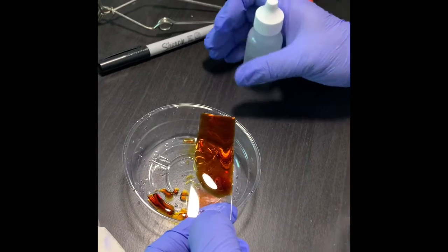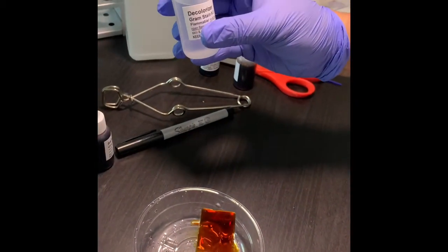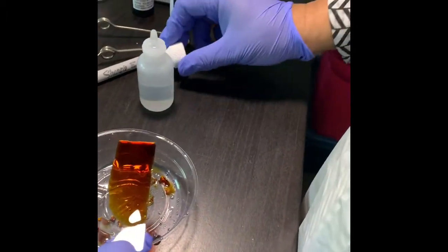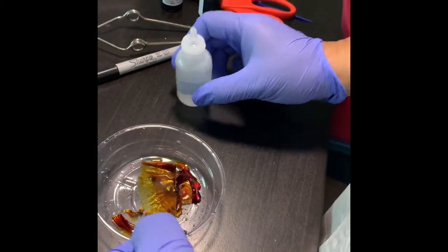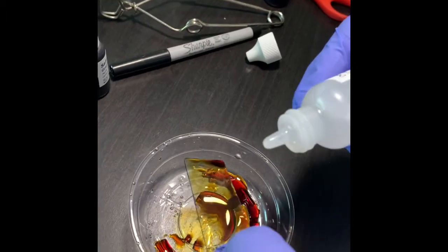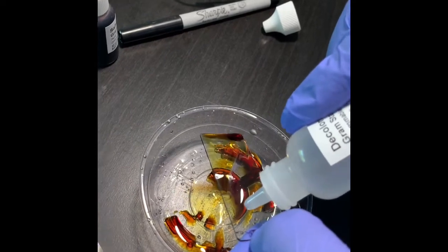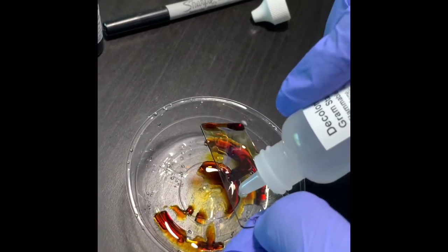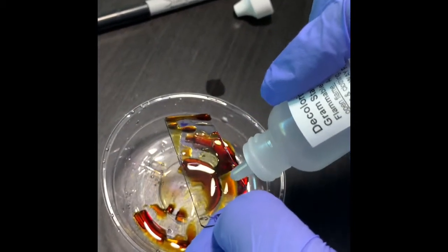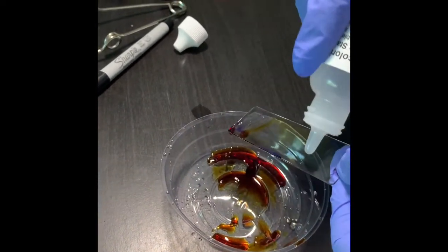This decolorization or decolorizing is very important. You can see the gram stain decolorizer. So you have to decolorize drop by drop, and it should be not more than 7.5 seconds for me, because see how I am dropping.